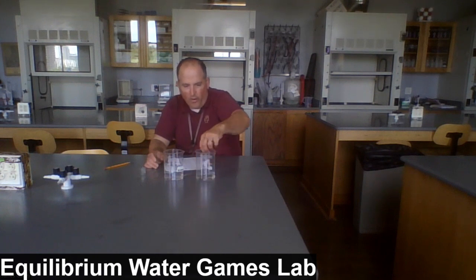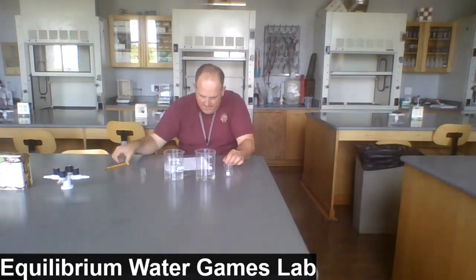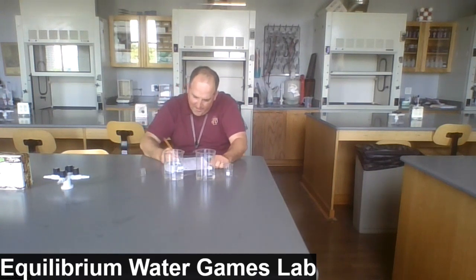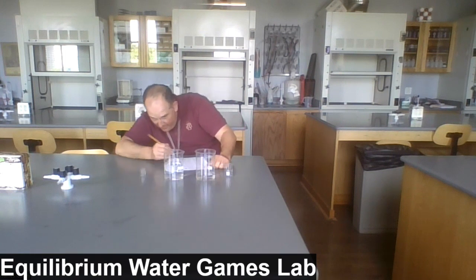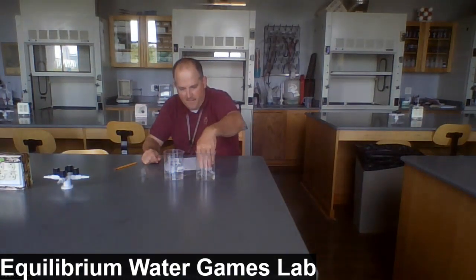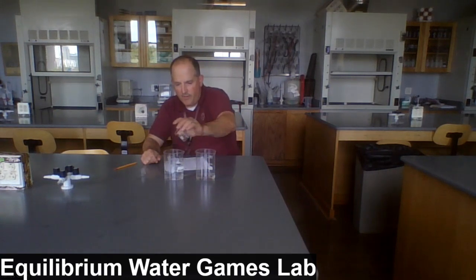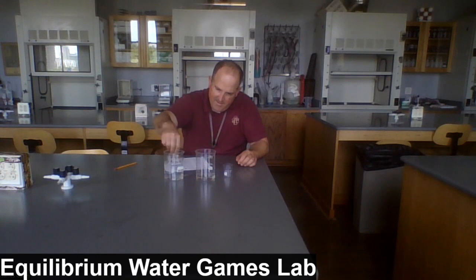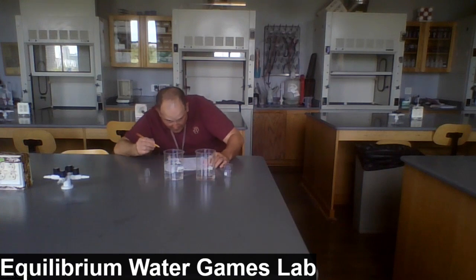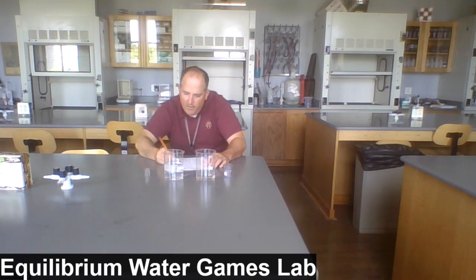After transfer cycle 4, our numbers are about 120 in beaker A and 390 in beaker B. And now I'm getting a lot less water in my transfer beaker than I was at first. After transfer cycle 5, we're at 100 in beaker A and 400 in beaker B.